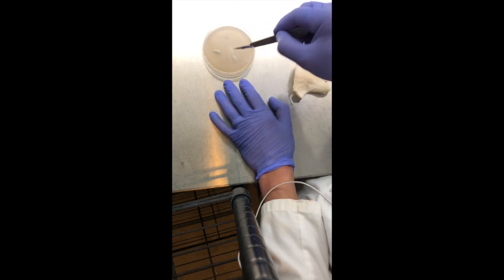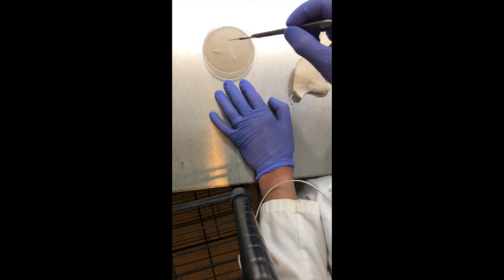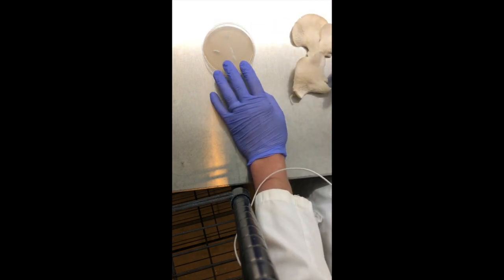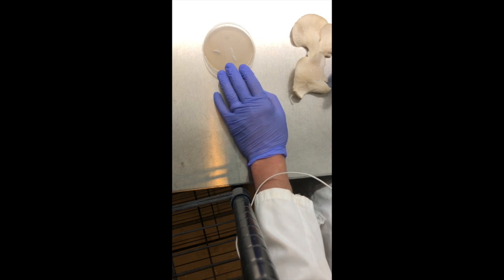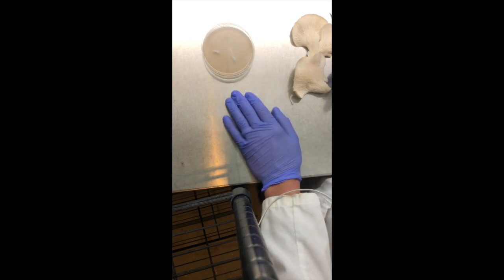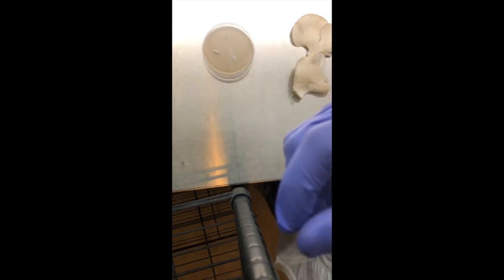I'm explaining the reasoning why I use so many tissue pieces per plate. When you clone a tissue culture, the chances of contamination are much higher. So I like to take multiple cuts, space them out, and as I observe growth I'll further select the mycelium and move it to the next petri dish.